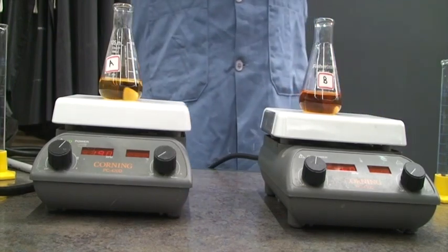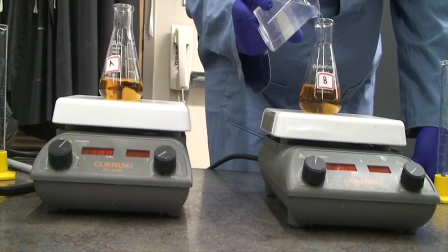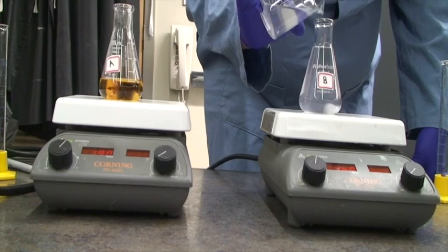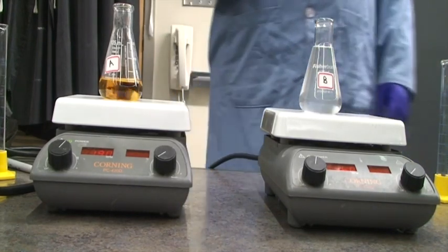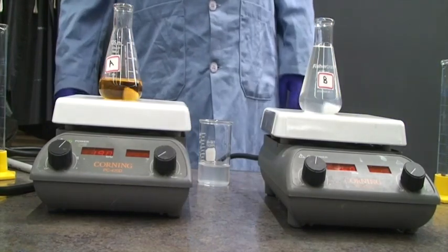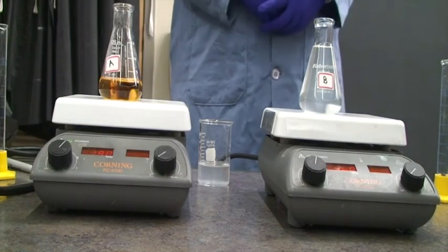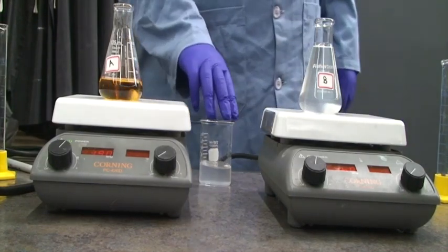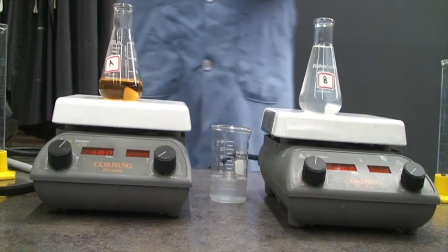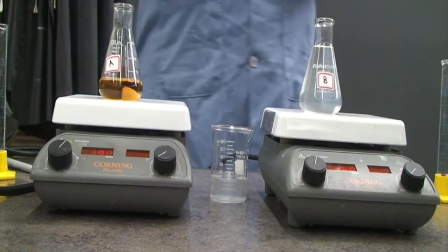I'm adding the sodium thiosulfate and starch solution to solution B. You can see it's turning darker and darker, and eventually the color disappears. So why is the color disappearing? It turned a little darker — you can see a bit of blue — but then it turns clear again. That's because sodium thiosulfate reacts with I₂ in solution to form iodide ions, which are colorless. We call sodium thiosulfate a scavenger for iodine.